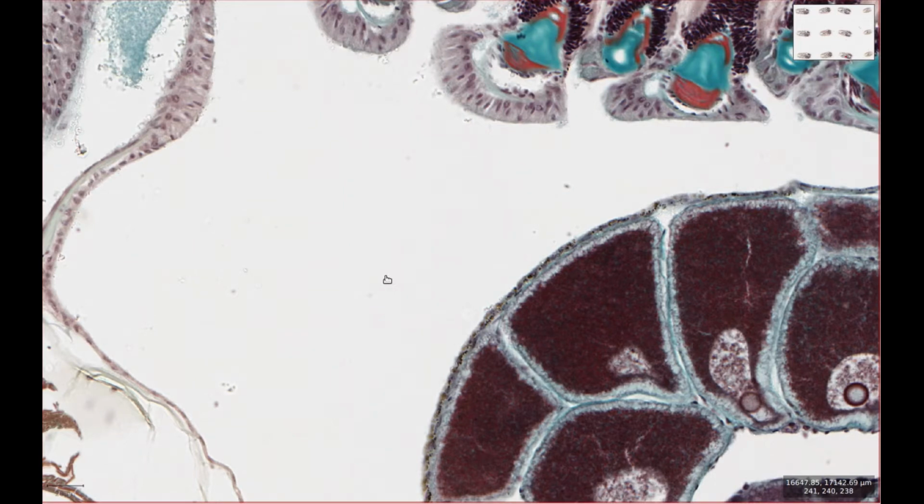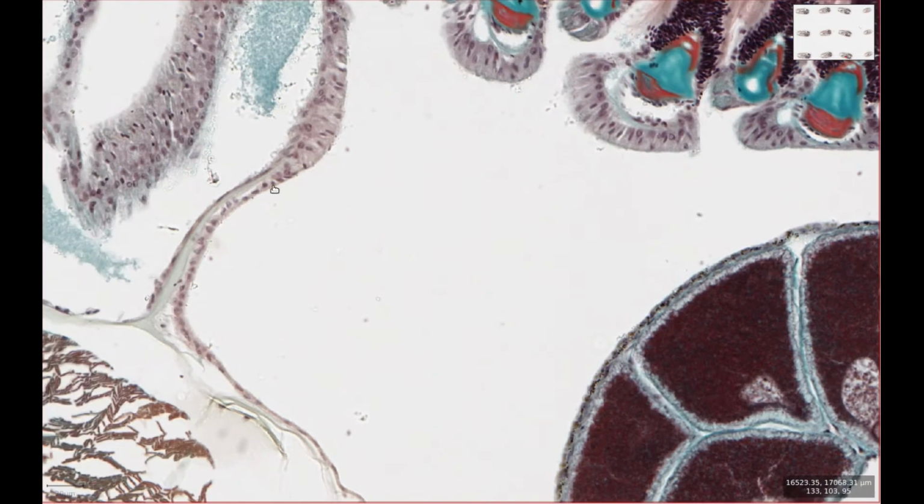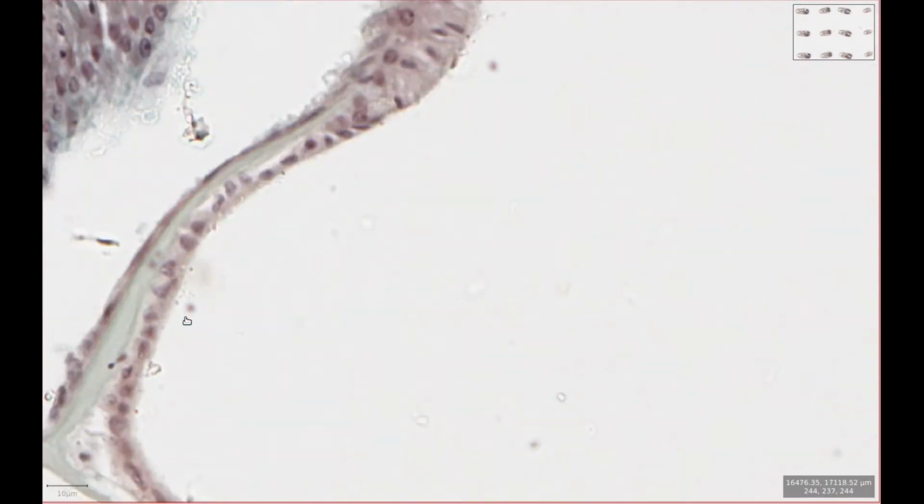and then water will pass into this structure here, which is called the atrium. This is analogous to the space between the gills and the gill covering in fish, which is known as the opercular cavity. As we can see, the atrium is lined by this thin layer of cells here. This is the atrial epithelium.